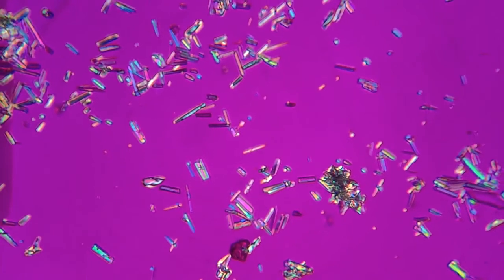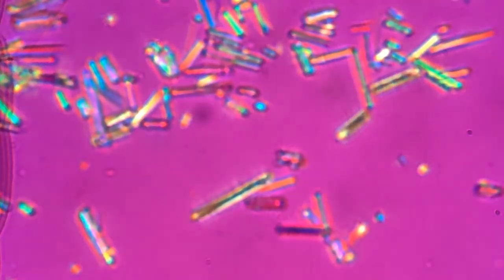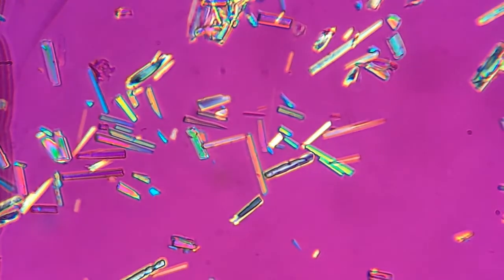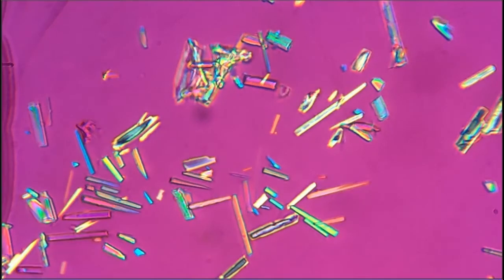While aragonite can form a blocky structure such as calcite and dolomite, its preferred habit is more acicular. Aragonite displays a very distinct cleavage on the 010 plane. This is what lends this mineral to the elongated acicular habit.